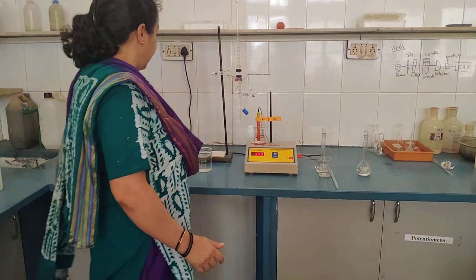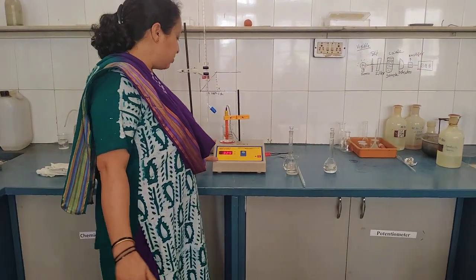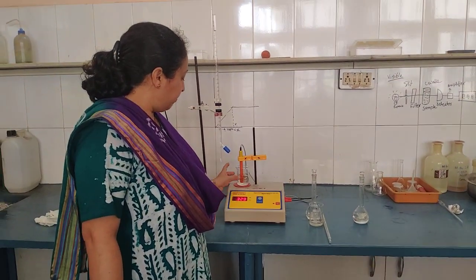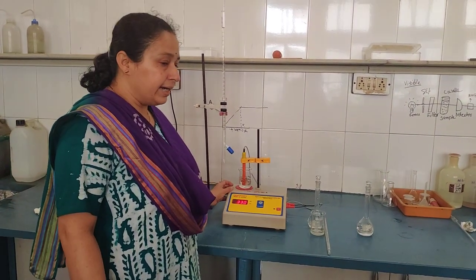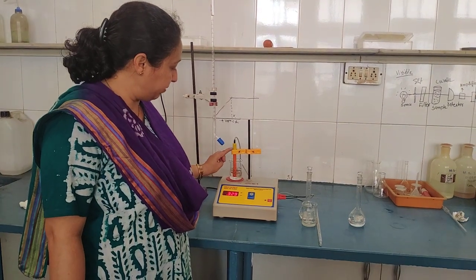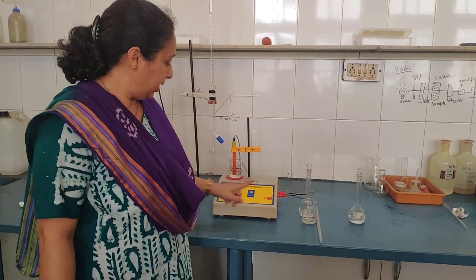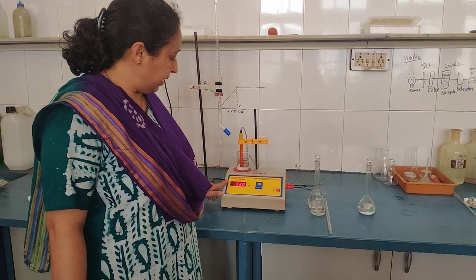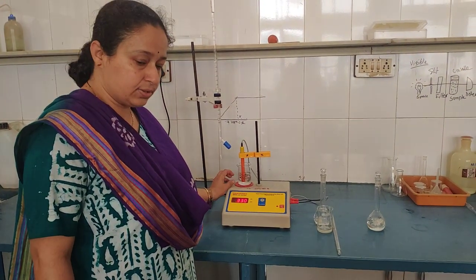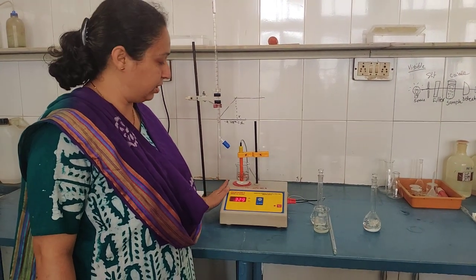First I will tell you about the conductometer. This is your conductometer — it measures the conductance of the solution. This is the on/off button and this display shows you the reading of the conductance of the solution.